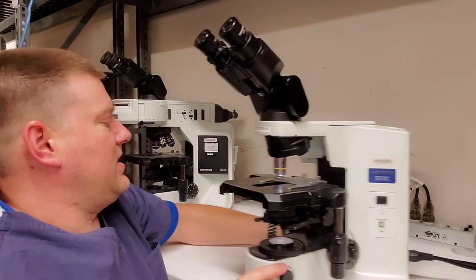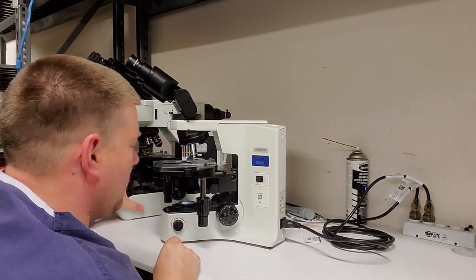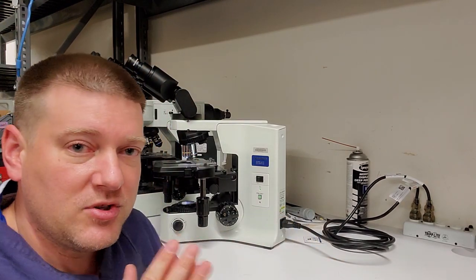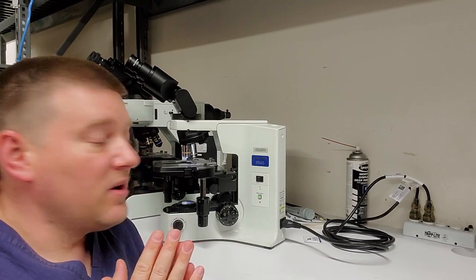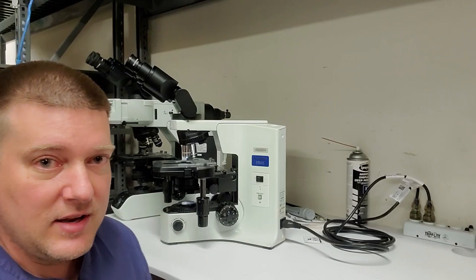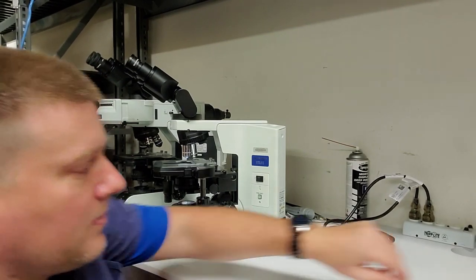Let's take this one over here, okay? Let's take the BX41. We're going to go ahead and take a look at it. I'm going to take it apart piece by piece, and I'm going to show you how to clean it. We are not going to go crazy in depth. It's just going to be a rough generic cleaning, the same that you would probably do versus maybe a microscope professional.